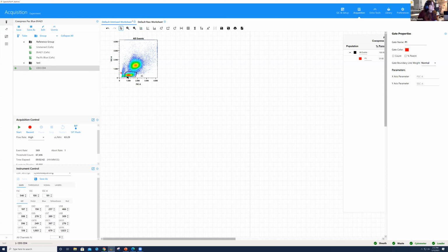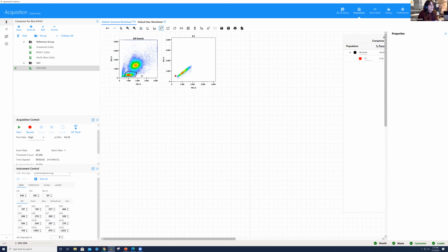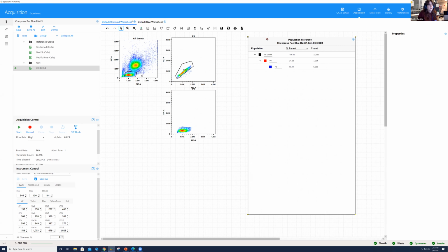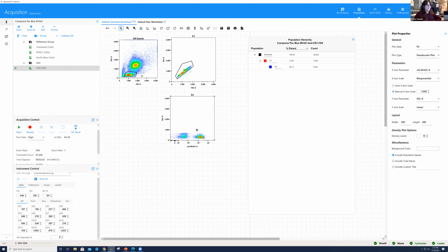co-expressing cells, okay? So I double click on this P1 gate right here. And I figured we would go ahead and do the gating strategy together. So we're going to do something very similar. Forward scatter height and area. Create a polygon gate for our singlets. Drag our population hierarchy over. And then what I'm going to look at here is CD3, right? So we see our nice, beautiful CD3 population, but is it going to be able to resolve CD4 as well?